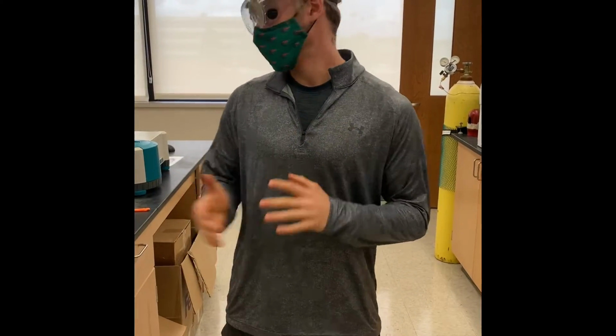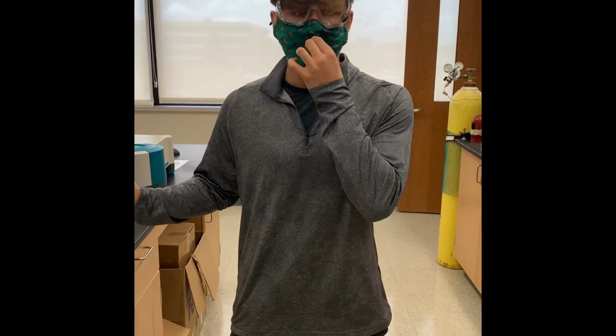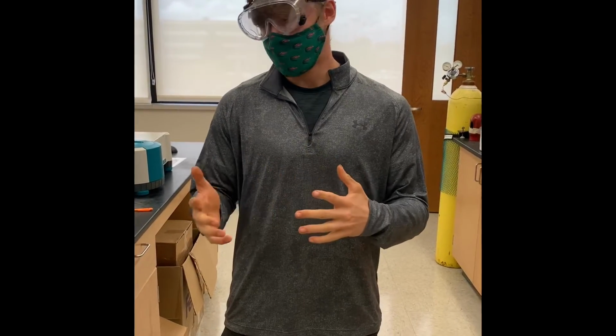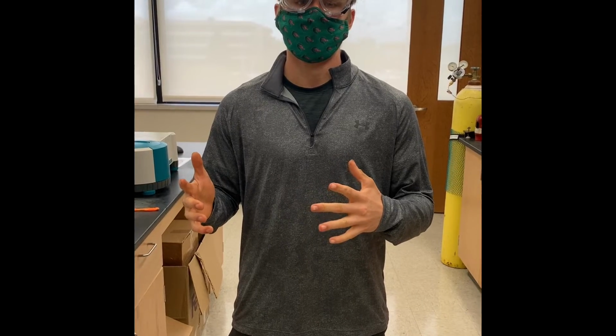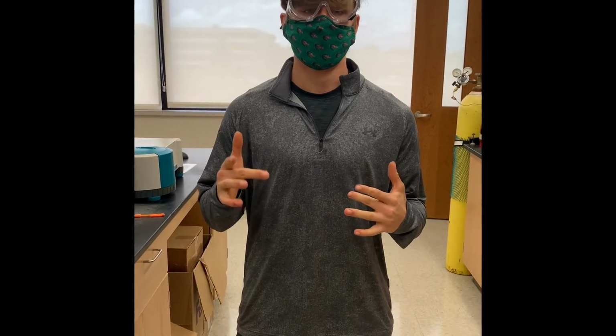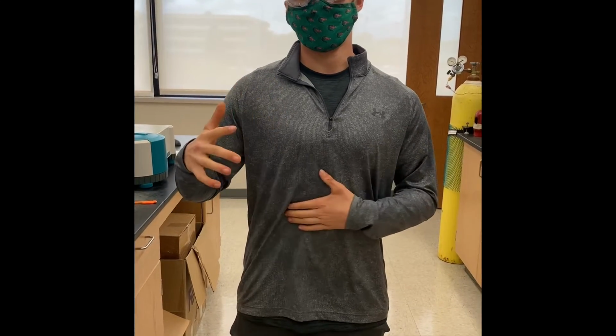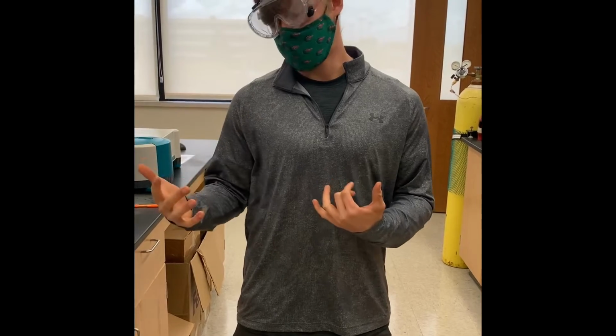Alright, so today we're using the spectrophotometer, and you can get qualitative and quantitative data from it. The qualitative data is that you'll be able to find the lambda max, and to see at what wavelength you'll find the lambda max. And then the quantitative data is how high the absorbance is at different wavelengths, such as the lambda max.